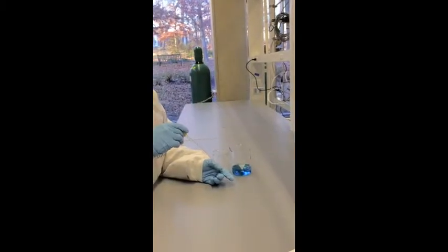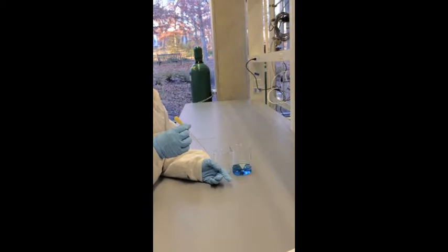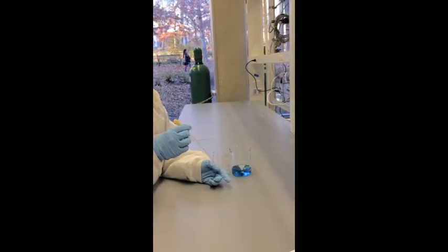Glass pipettes are disposable pipettes that require a non-disposable bulb. They are much easier to use for solvent transfer than volumetric pipettes. To pull up liquid, squeeze the bulb, and to release liquid, squeeze the bulb again.